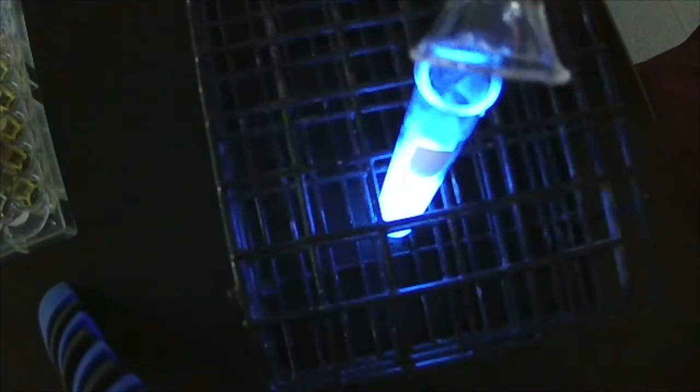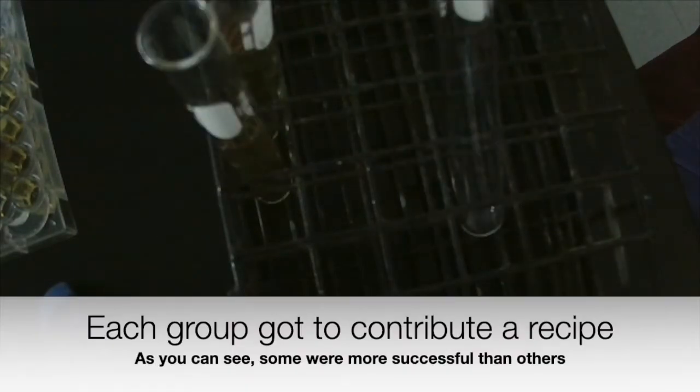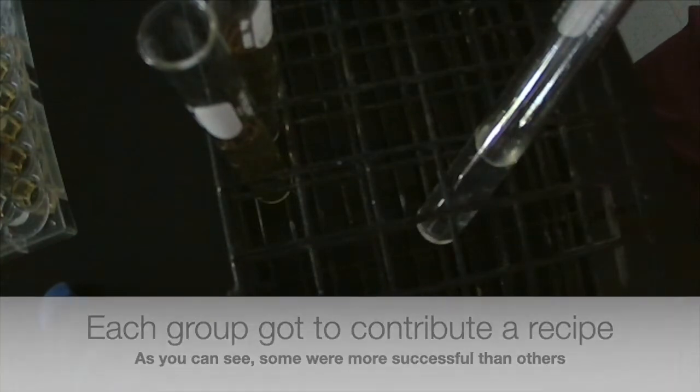And then we have luminol. DMSO. DMSO, bleach, hydrogen peroxide.